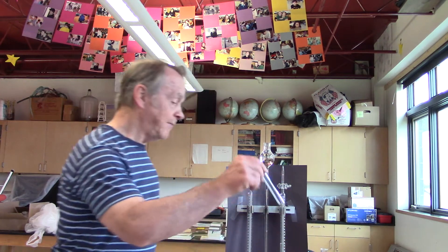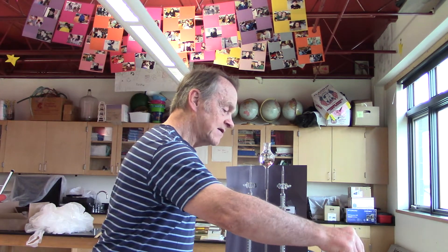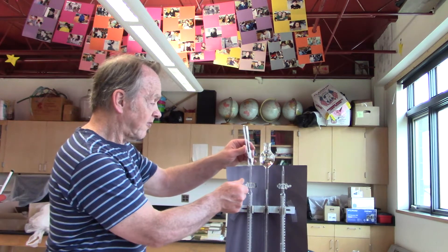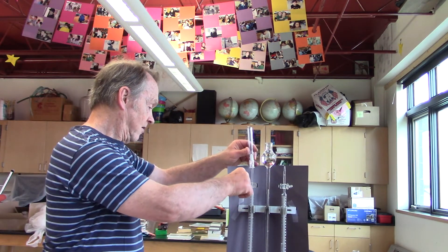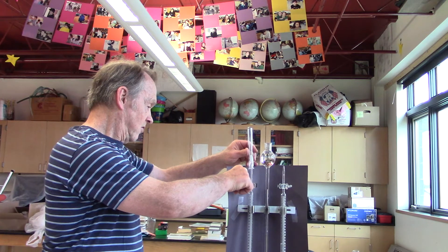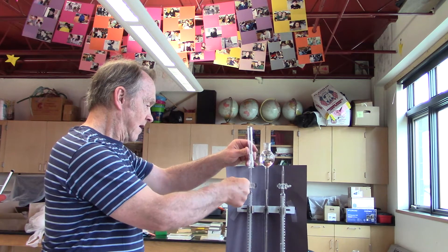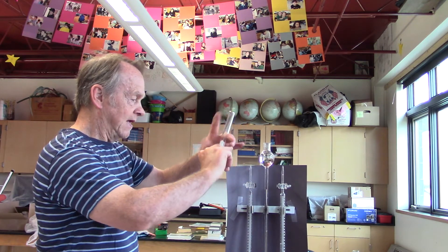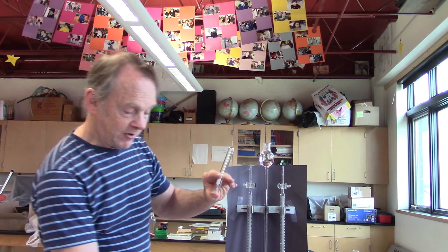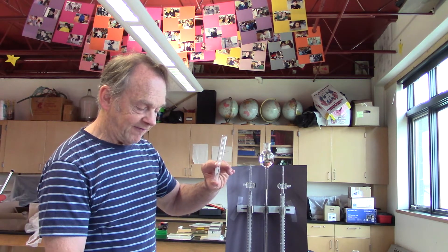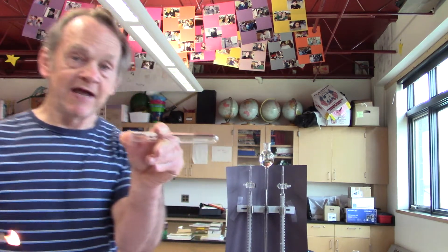Now all we're looking for right here is evidence, more evidence that we have hydrogen and oxygen. So I'm going to try to collect the oxygen first. So I open this up and what I'm believing right now is that this is full of oxygen. So I'm going to bring it over here where you can see it.